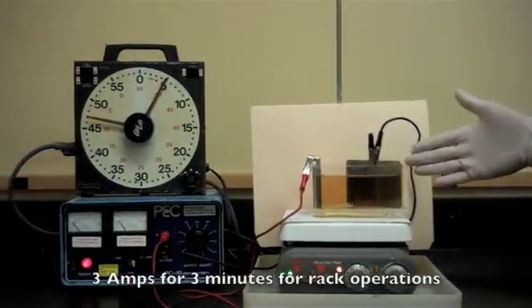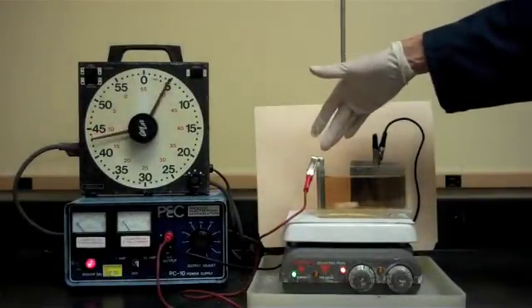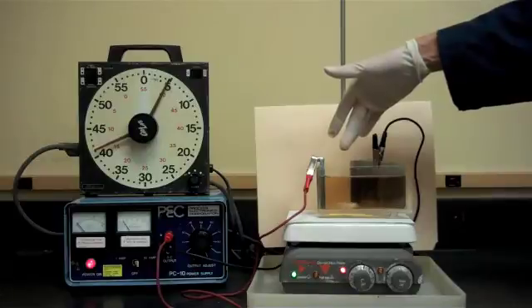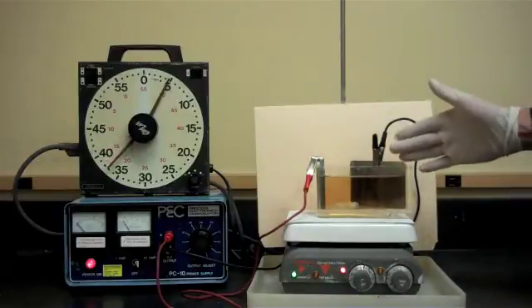As you can see, what is happening here is at the zinc anode the zinc is dissolving into the solution and it is plating onto our steel panel at the negative lead.